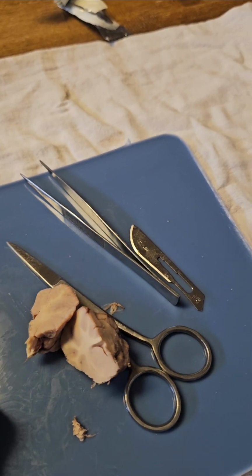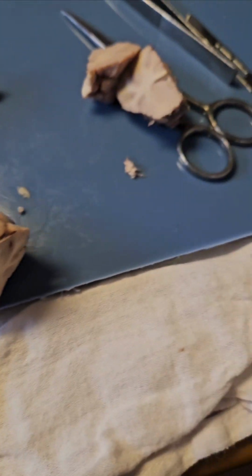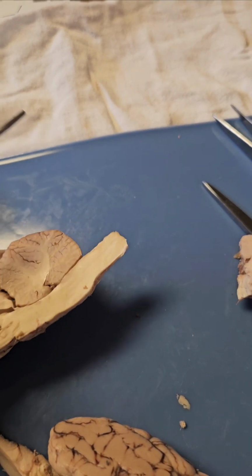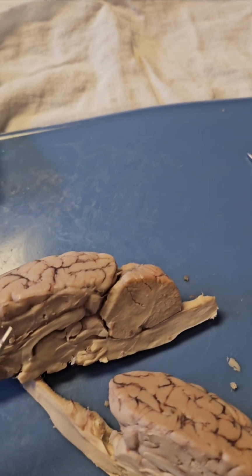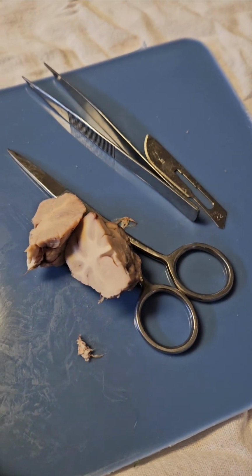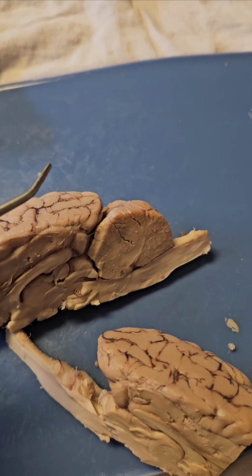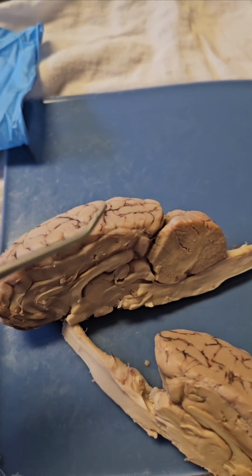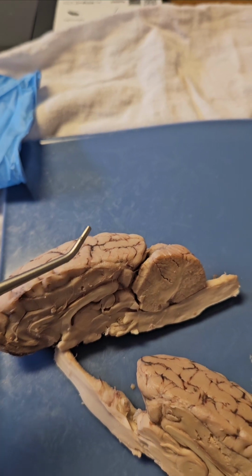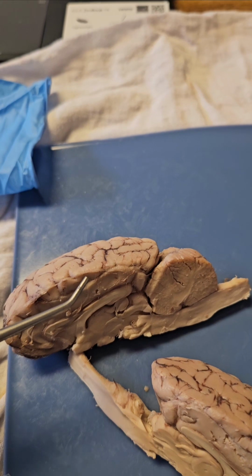And then we've got the brainstem and the spinal cord. The brainstem has the medulla, the pons, and the midbrain. So medulla, pons, midbrain. It regulates sleep-wake cycles, emotions, and bladder and sphincter control, also facial movements, auditory and visual processing, and regulating of motor functions.